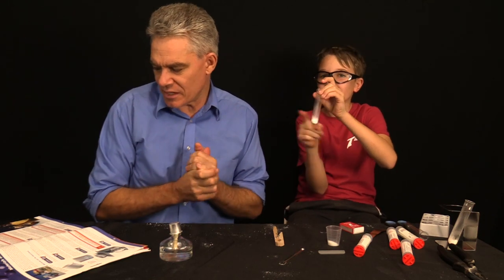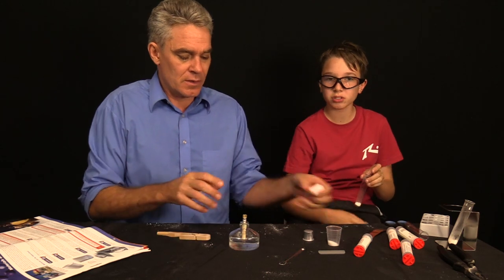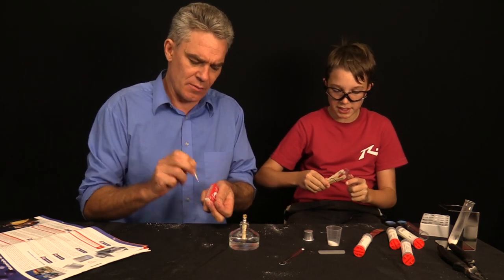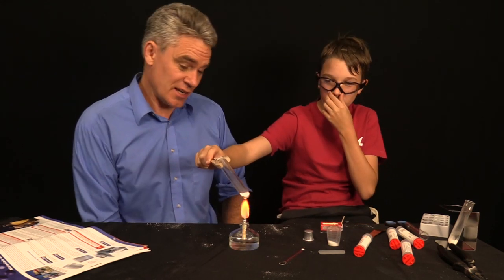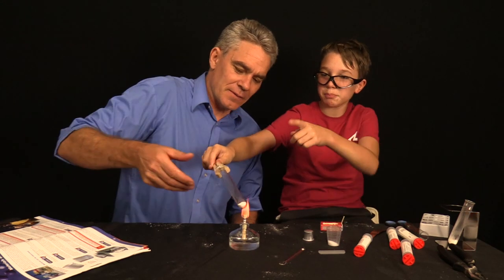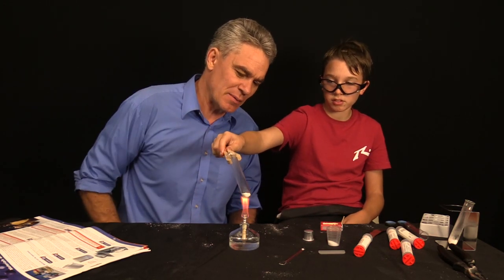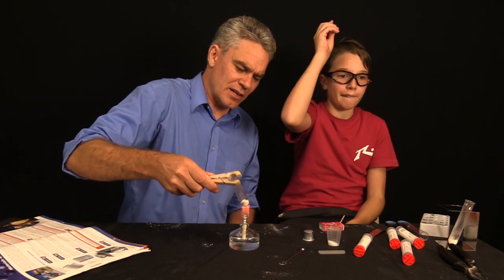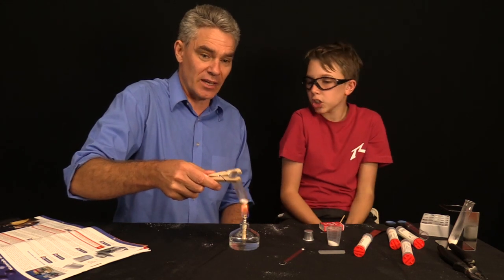And it says, heat it. You will notice a piercing odor that we didn't get in an earlier experiment. Let's see if we get this piercing odor. We'll be getting a chemical reaction. I don't think Sam's about to smell a chemical that I don't think he's ever smelt before. I think I can already smell it. No, you can't smell it already, mate. I see some vapor coming out. It could be just the calcium hydroxide coming off. Let me give it a bit more direct heat.